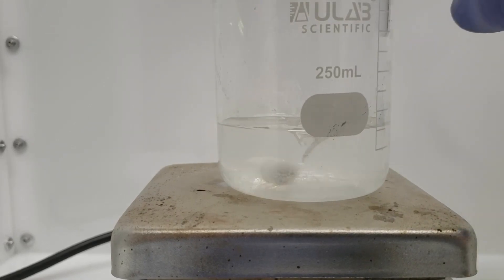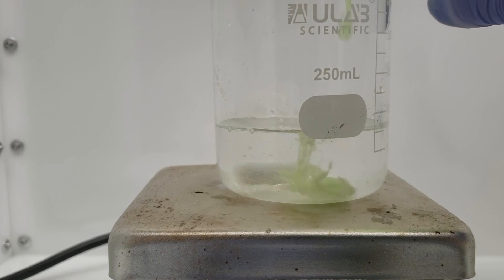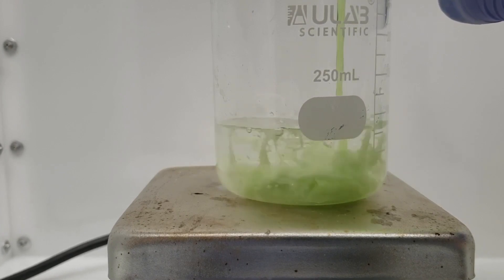After the solution of oxalic acid is ready, the now cooled solution of praseodymium chloride and hydrochloric acid is added. This cool effect forms.